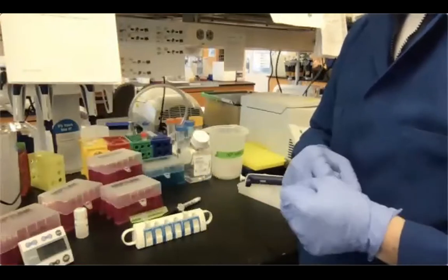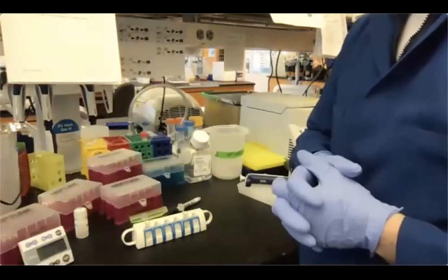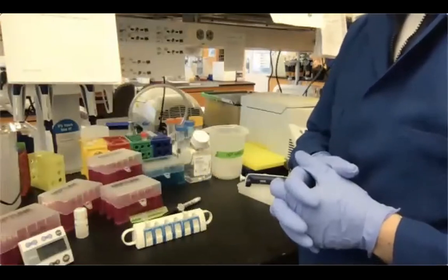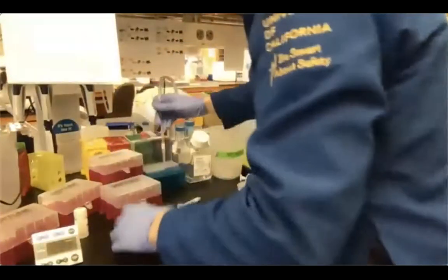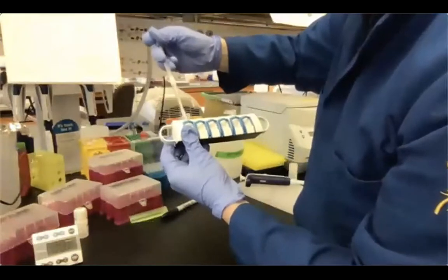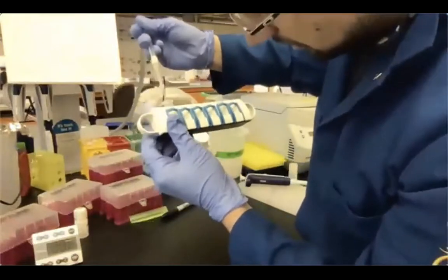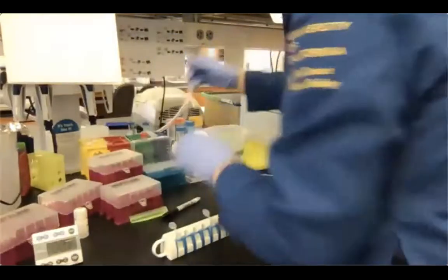So remember, every time I recover from the Ampure beads, I usually prefer to leave like 1 or 2 microliters in, not to have beads carry over. Okay? All right, 2 minutes expired, almost expired. So I'm just going in, removing the rest of the ethanol. I'm looking for some other droplets. Sample is good.